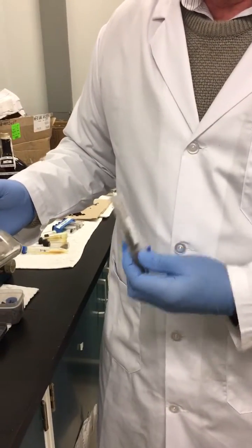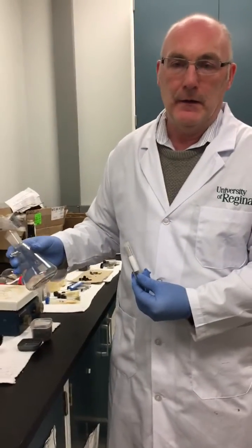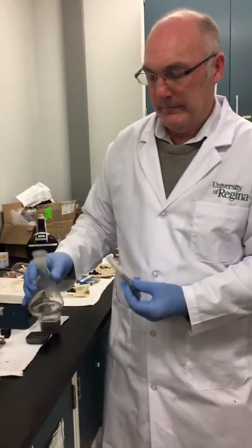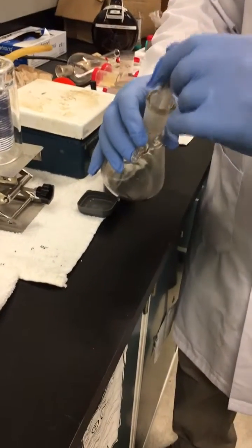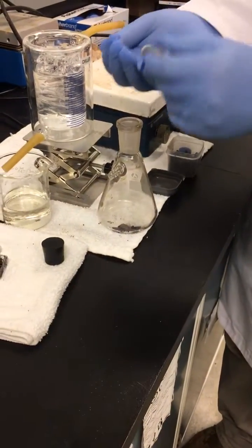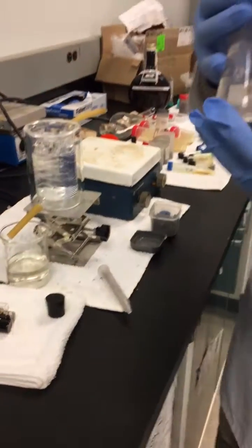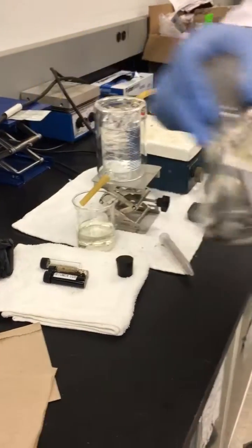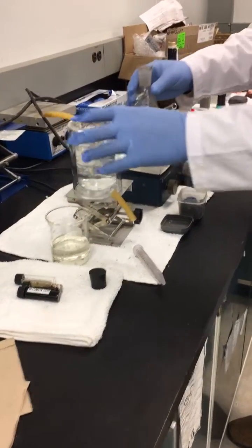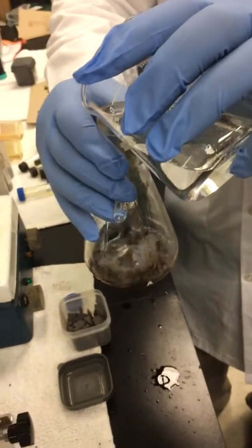When you see the surface tension of the liquid bubbling, it's not that the liquid catalyst is hot and vaporizing — it's actually extracting the tight gas from the oil shale. We've now added the components together: approximately 25 grams of rock.